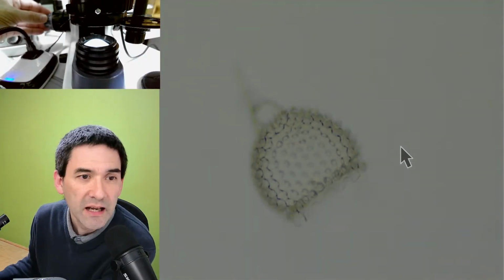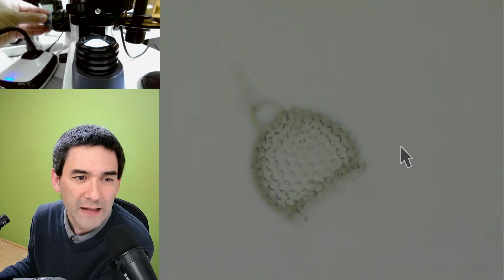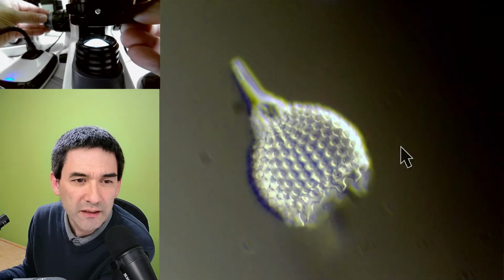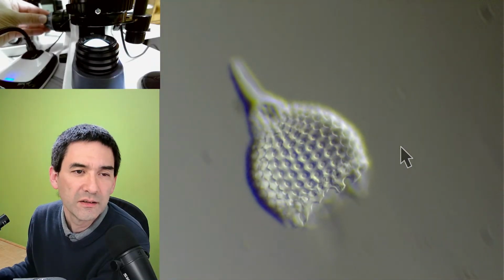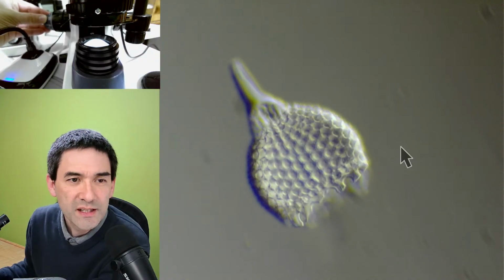And this is basically how it looks without the filter, right? It looks much more flat. But if you just move the filter in correctly, yeah, it's too much. And you can actually see that it looks much nicer.